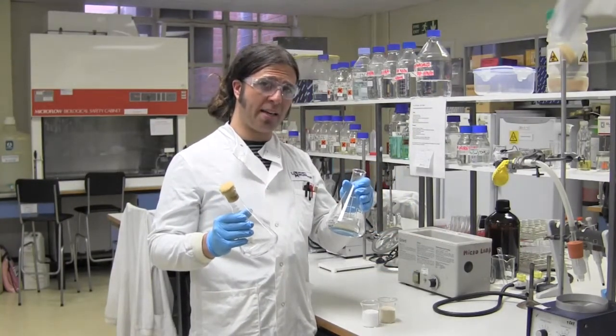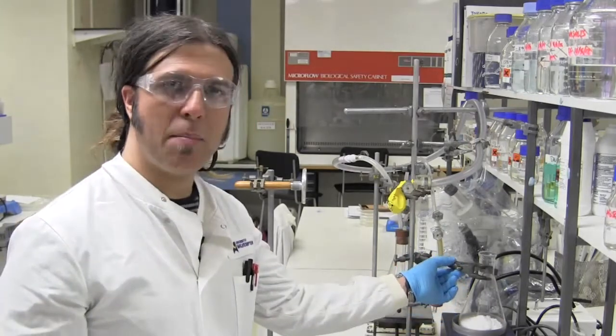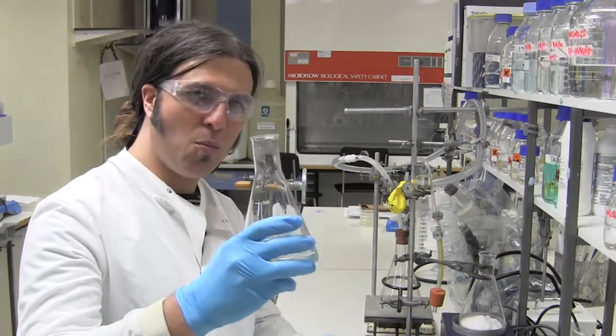Does it fizz or does it bang? So what we've done, we've added our glucose and our yeast to this conical flask here and clamped it in this clamp. Now what we're going to do is add some warm water.